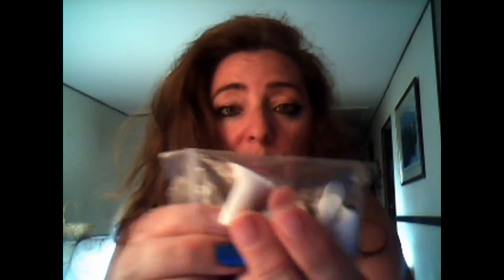You just download the online software — it takes two seconds. What it does is it turns on your computer camera, so you might think there's some sort of error, but if you look at the bottom of your applications you can see that the microscope software is downloading.